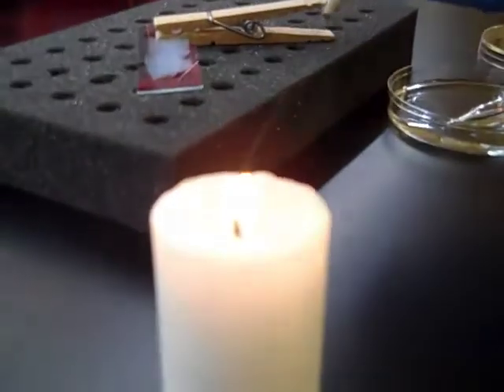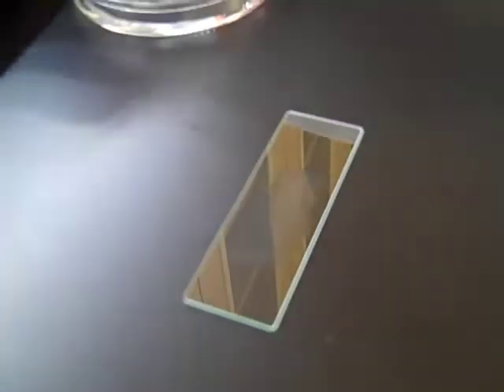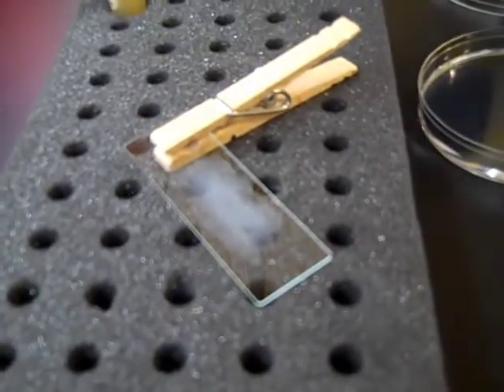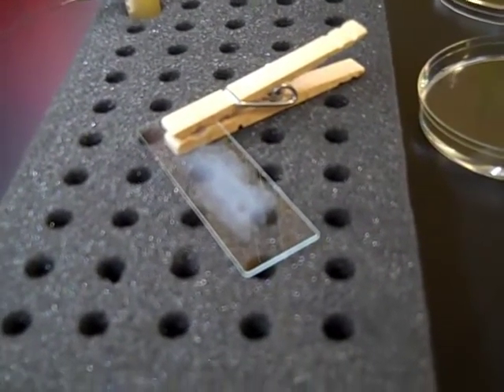If you use too much water, it can take a while. So what we've done here is we already have a slide that we have let air dry. This is what it will look like — it's going to appear cloudy. You want to see that you've got some bacteria in the mix.